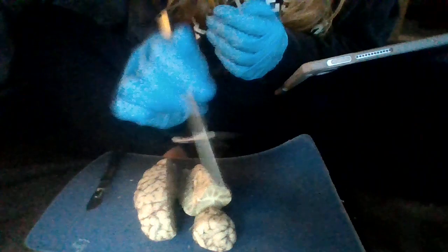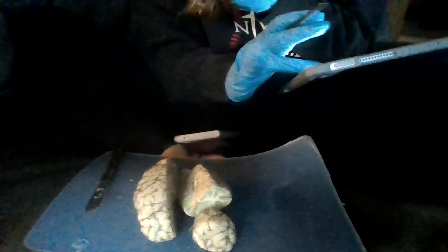this part here is going to be more of our frontal lobe, and for quick definitions, our frontal lobe is going to be the area which controls our motor functions. And then we also have our parietal lobe, I'm terrible with words, which is going to be this area across here, the top or mid portion of our brain, which is going to control our sensory info, kind of where we receive and process our information.